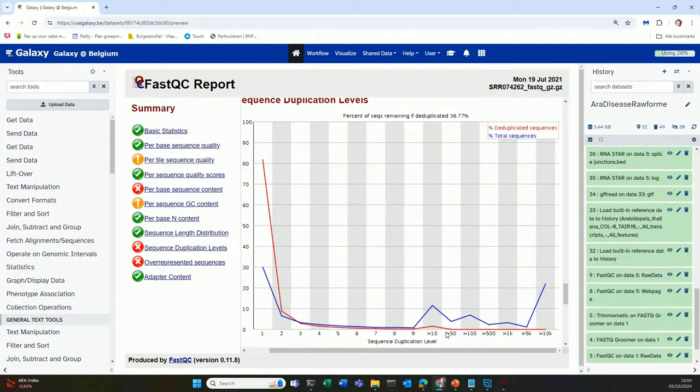Another reason why you see duplication in RNA-seq data is the ribosomal RNA. Although you try to remove it as much as possible, there still will be some ribosomal RNA in your RNA libraries. And ribosomal RNAs are very similar, so they will generate identical copies. That's another reason. And indeed, this peak here at the utmost right of your plot, in almost all cases, indicates something that is called adapter contamination. Where does that come from?